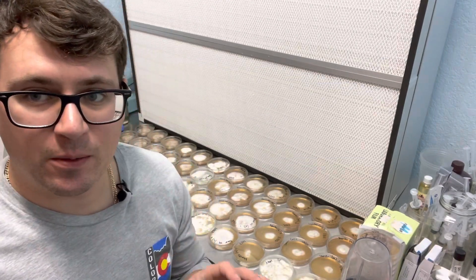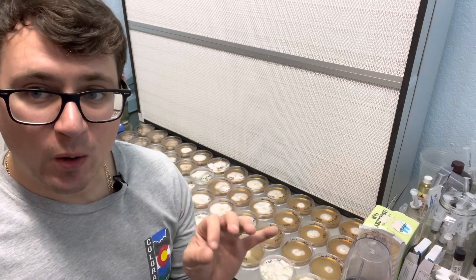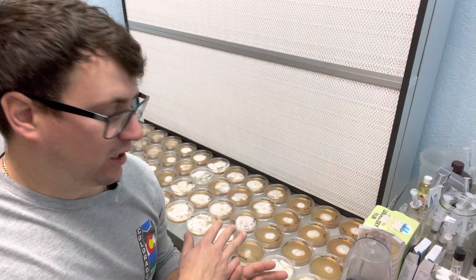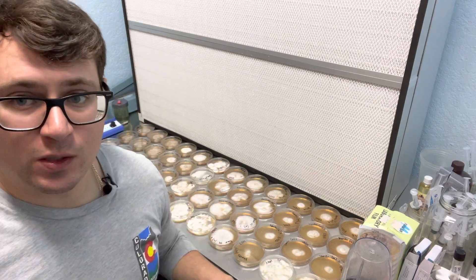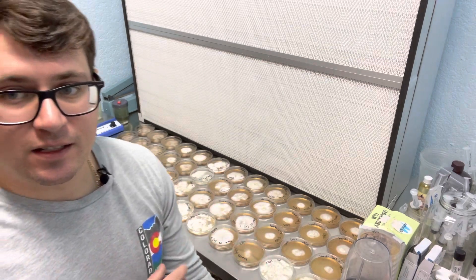What's up guys, it's Gary with Fresh from the Farm Fungi. I wanted to do a quick pro tip today on how to reduce condensation in petri dishes. I'm about to be transferring all these different phenotypes onto slants.